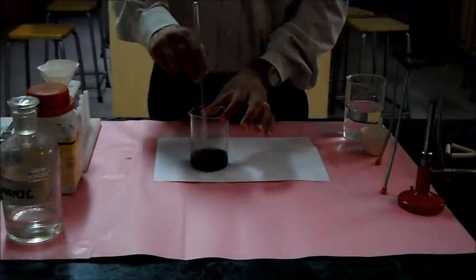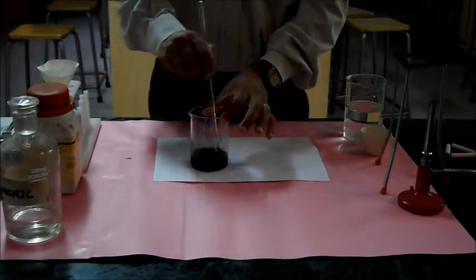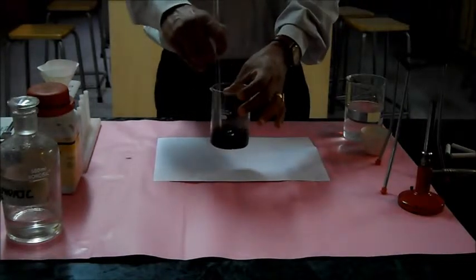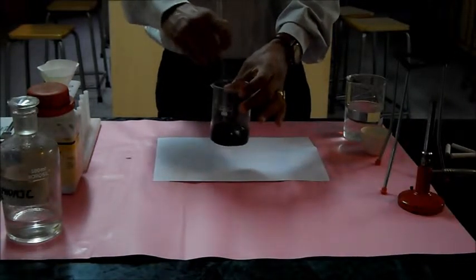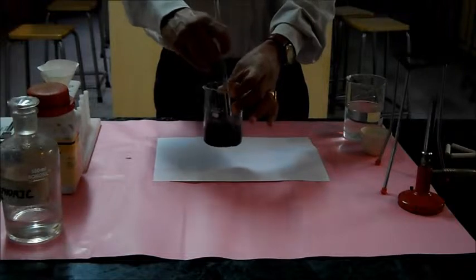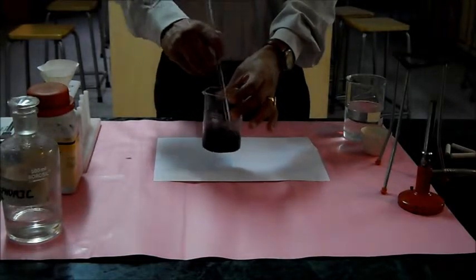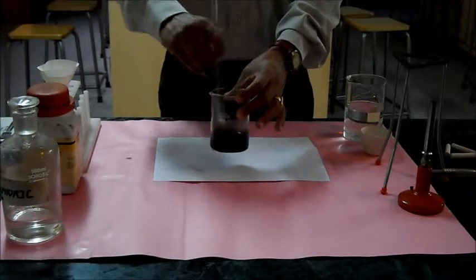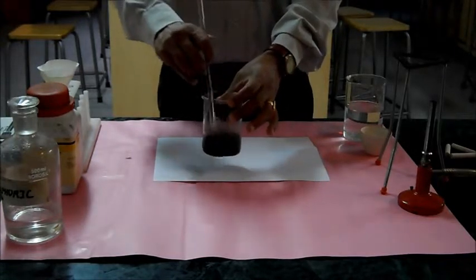I will use glass straw to stir it. In this, the copper oxide as base has neutralized the acid and due to the color of copper oxide, though the copper oxide has neutralized the acid, this solution looks black.